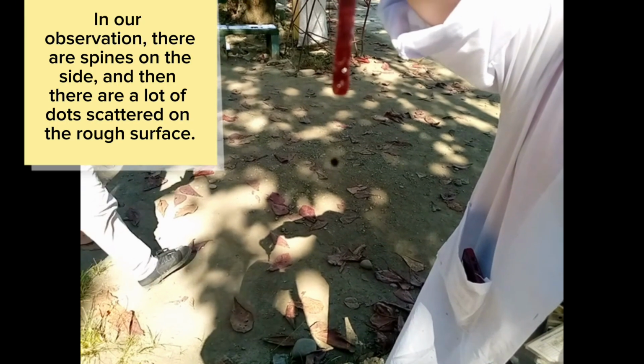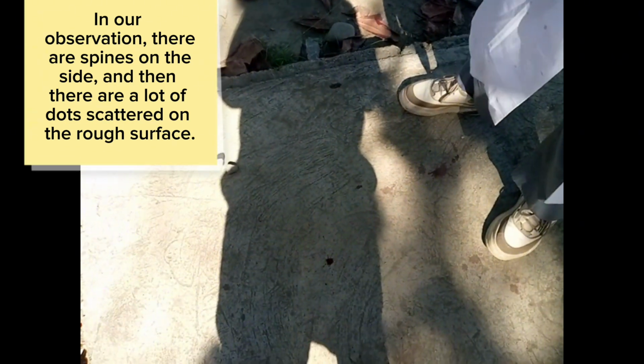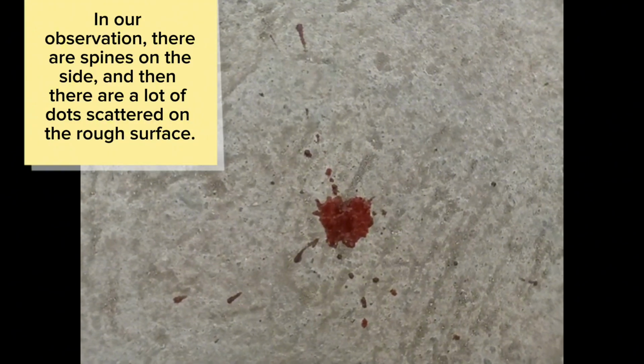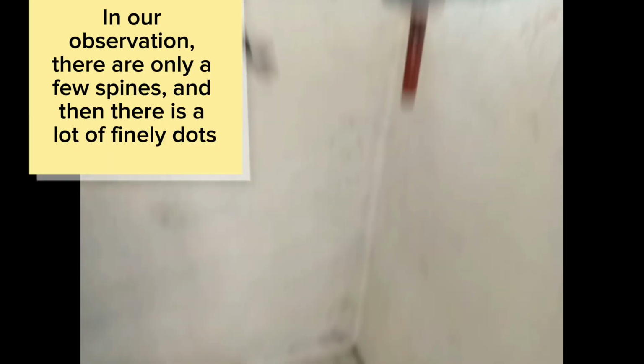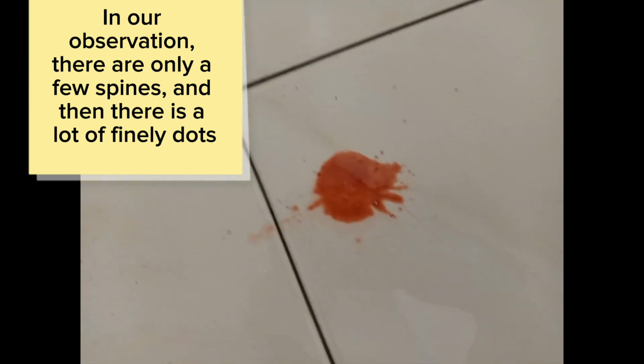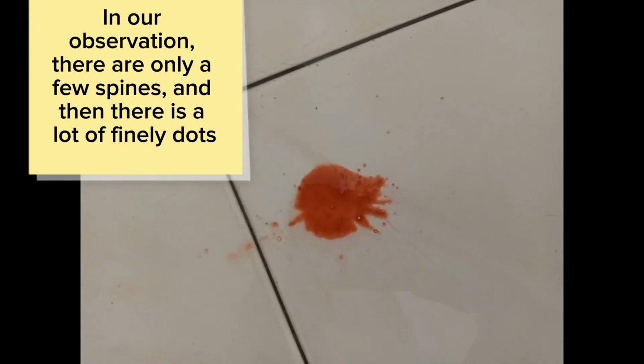Part 3. Blood spatter on various surfaces. Rough surface. In our observation, there are spines on the side, and a lot of dots scattered on the rough surface. Smooth surface. In our observation, there are only a few spines, and there are a lot of fine dots.